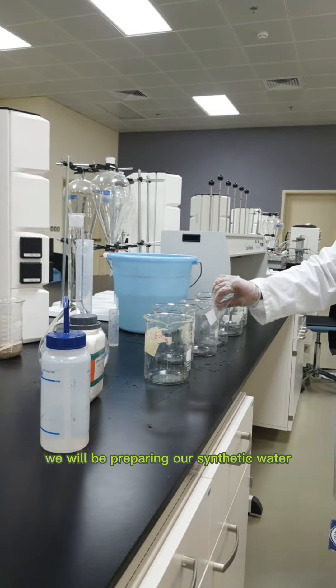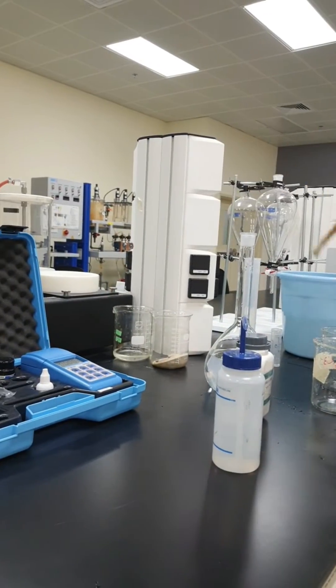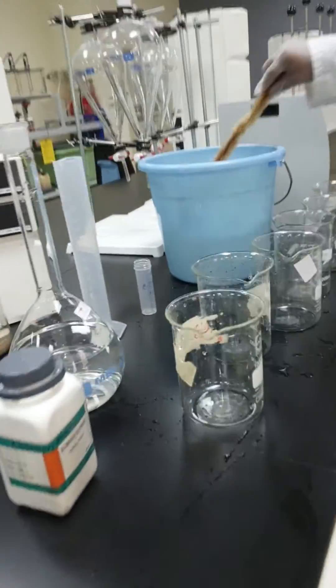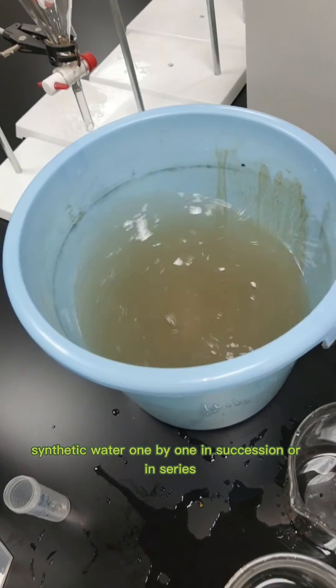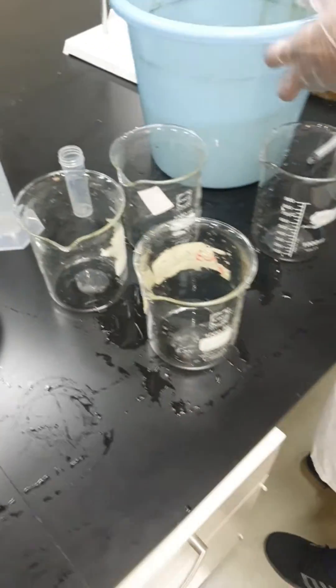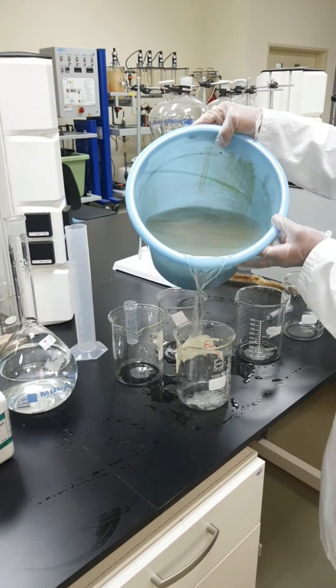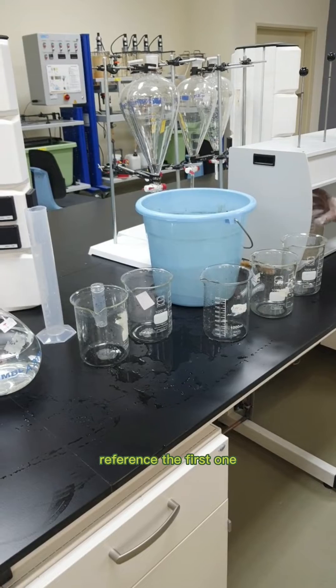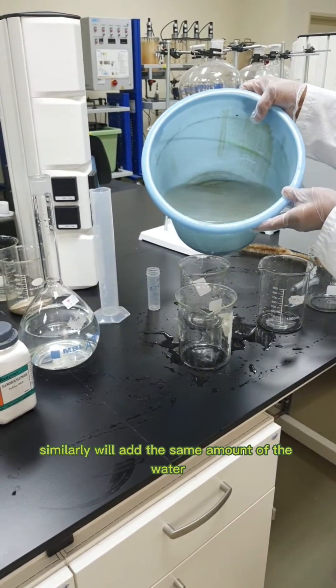Now we will prepare our synthetic water which is here in the bucket, and then we will transfer this synthetic water one by one in succession to the jars. This first one will be our reference, and similarly we will add the same amount of water to the others.